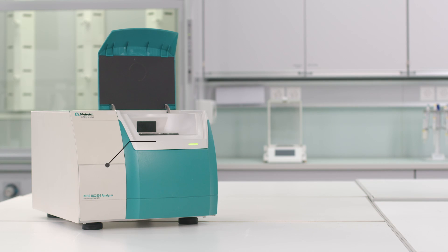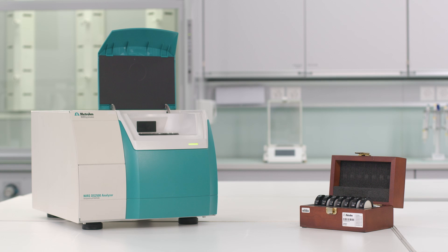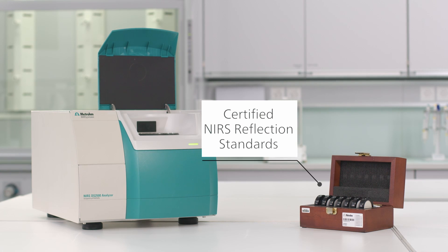In the regulated environment it is necessary to perform an instrument diagnostic test every week. For non-regulated environments we recommend performing an instrument diagnostic test on a monthly basis. You can do this using either the internal standards or with certified external standards as required by USP.